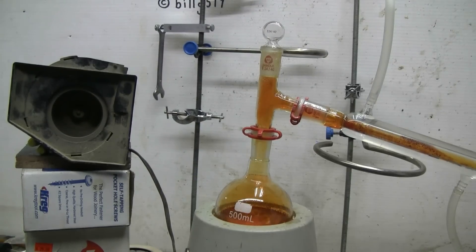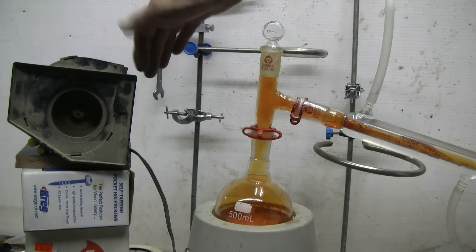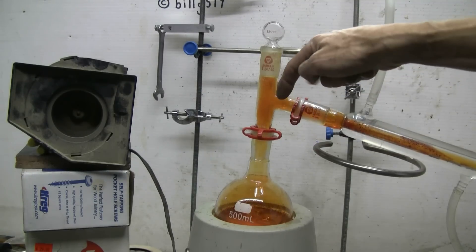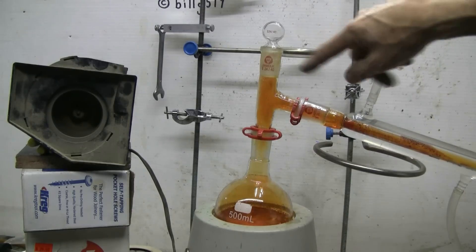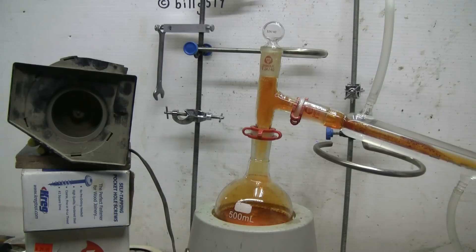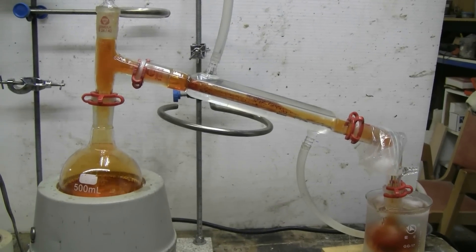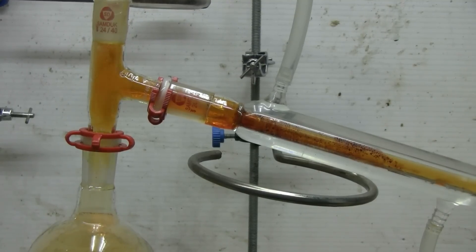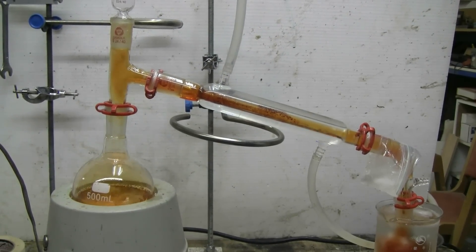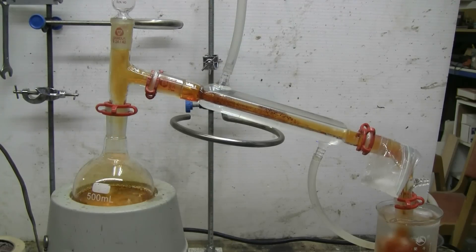A fair amount of bromine has come across and I was starting to get a lot of water coming across, so I've put a fan blowing air onto my three-way adapter so that a bit of refluxing can happen and the water can condense and drip back down into the flask while the bromine continues to come over. Some bromine is still dripping into the collection flask so the simple distillation will need to continue a little while yet. The liquid in the boiling flask is now a much lighter color and I'm going to stop the simple distillation shortly.